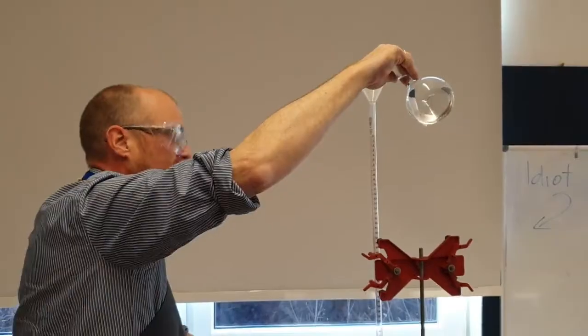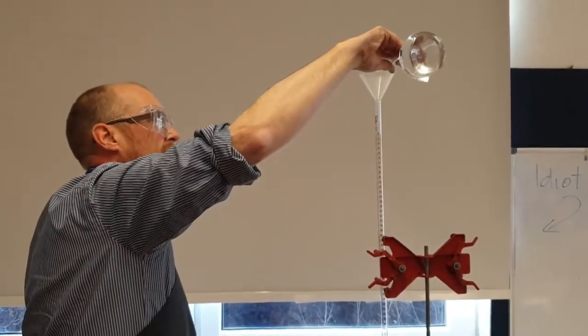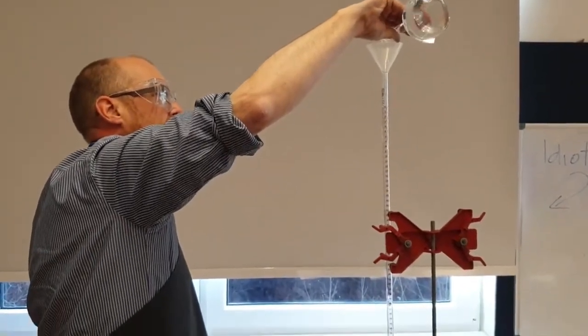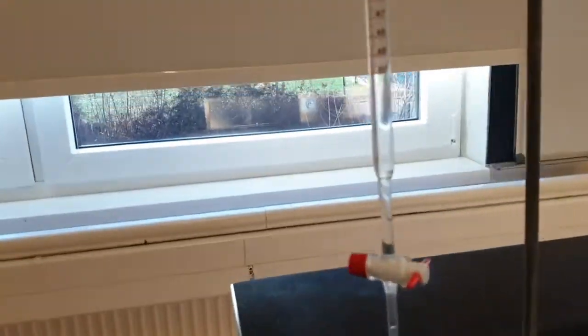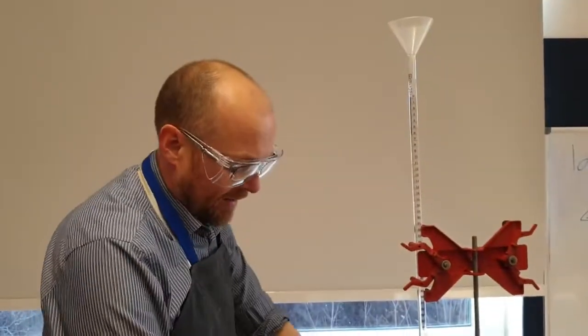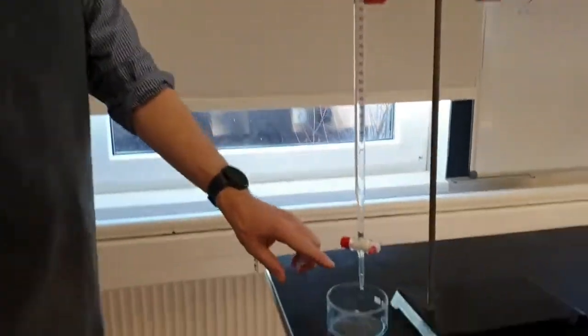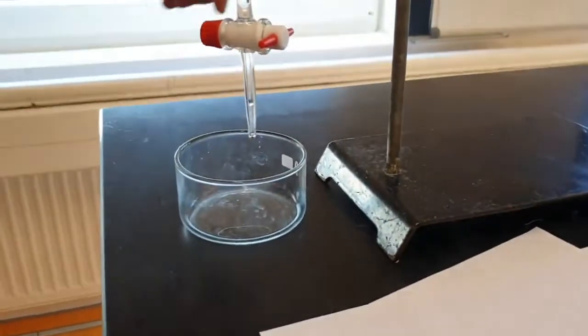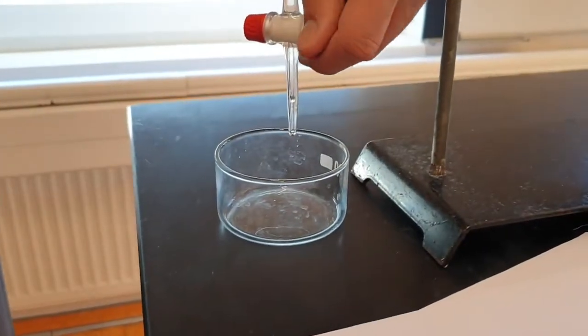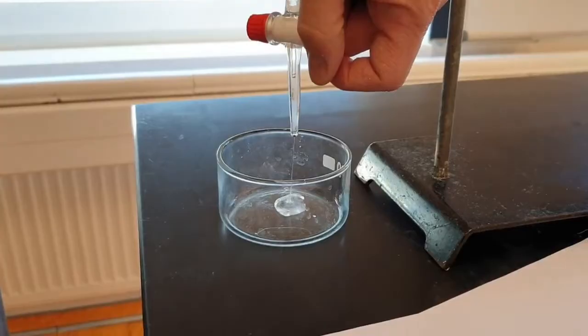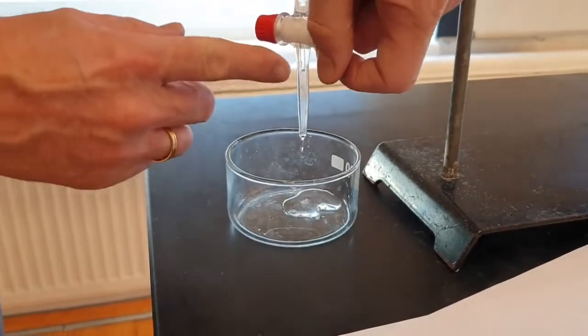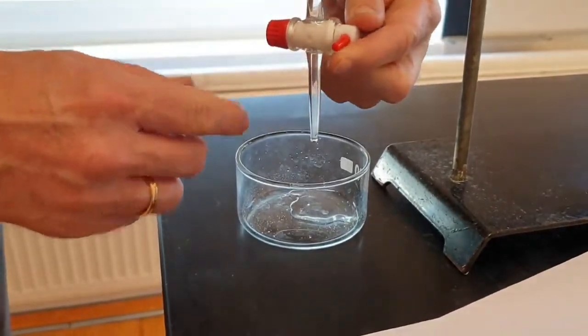Definitely goggles on. I closed it at the bottom so let me add up to about the zero. I've got to clear the air gap under here. There will be a systematic error. There's air in there, so I'm just going to clear that out. Is that gone? Oh, it's still there. Come on. There we go.